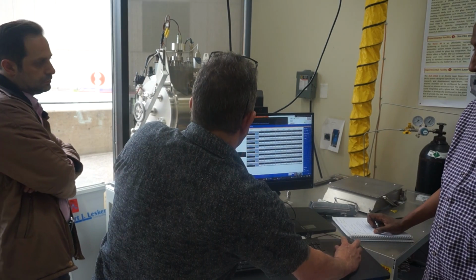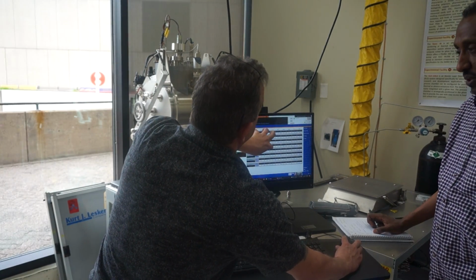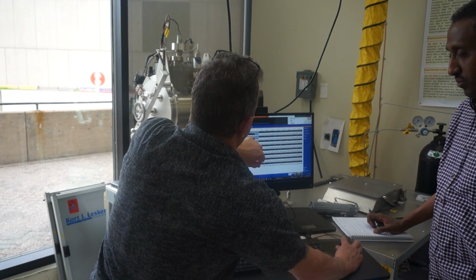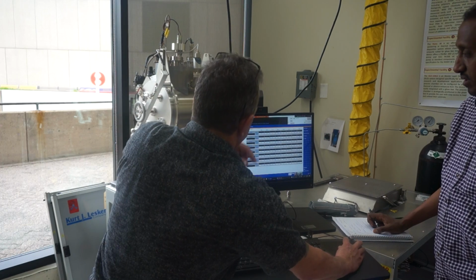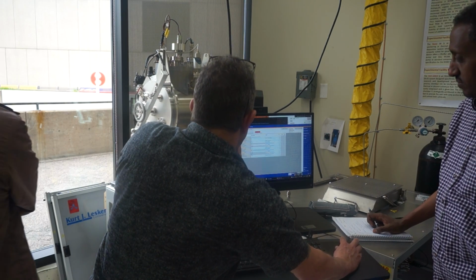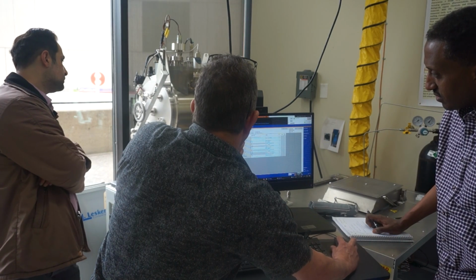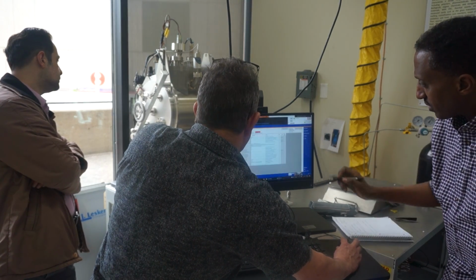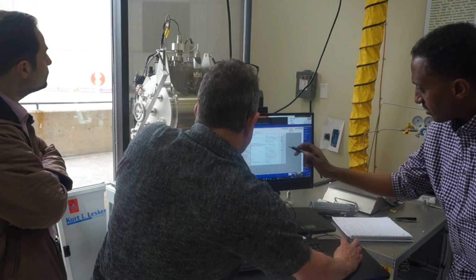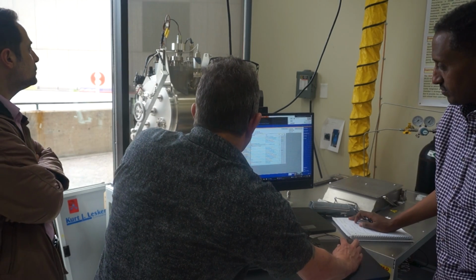The process parameter, yes, in the experimental design. As far as this matrix, it just populates itself. So which one is that? This is the sub-recipe here. Right, that is the process parameter. Then it sets the process phase.